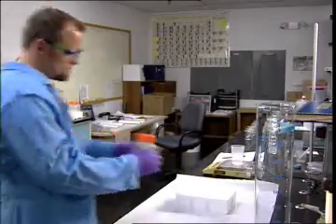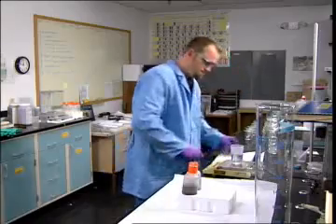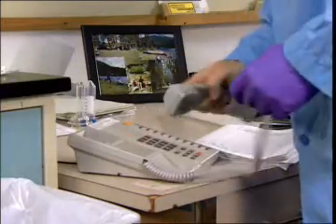George just completed a test on a sample of material from a new synthesis. The phase separation is just as predicted. George logs in the results, and then he calls the production supervisor. With these results, they can continue with phase 3 of the project. This test wraps up phase 2.